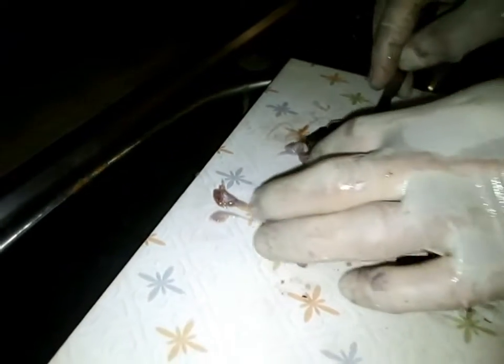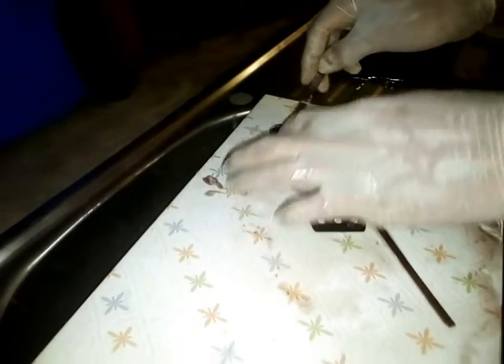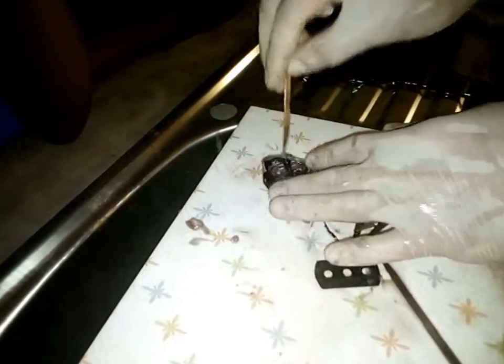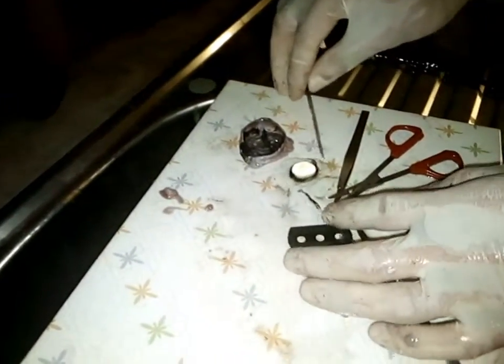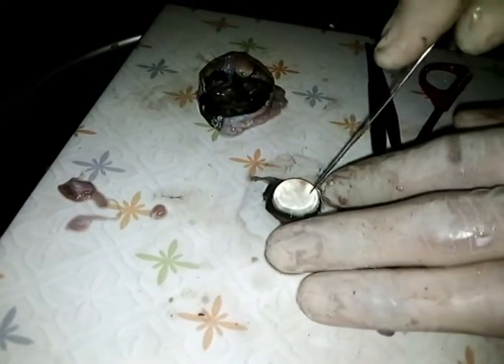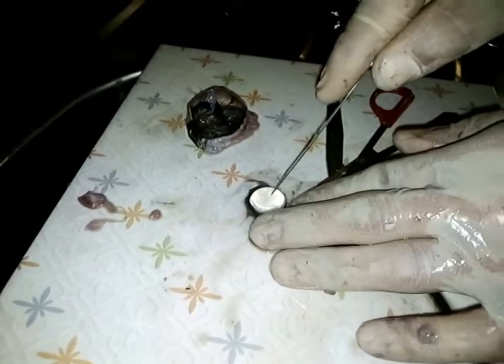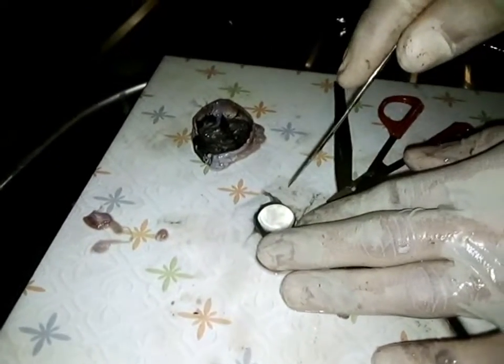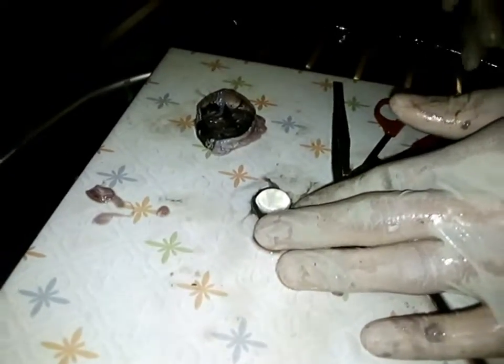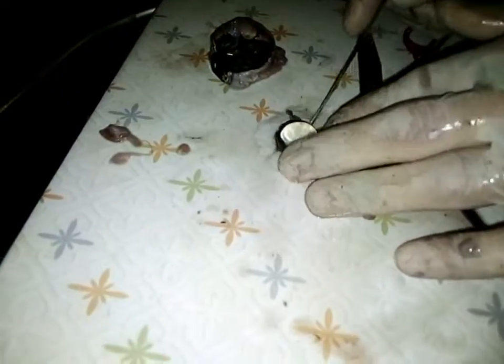Now, let me turn it back. Look at the real eyes of the beast. You can see the iris along this part. Now, if you look at this particular part, you see this is an important part, the lens. Are you getting me? Now look at this. If you look through the lens, you see that this has been magnified. This here, you see it's bigger. Do you understand? So the lens did what? It increased it. Are you getting me? It magnified it. That's what the cow is able to do, to see. Are you getting me?